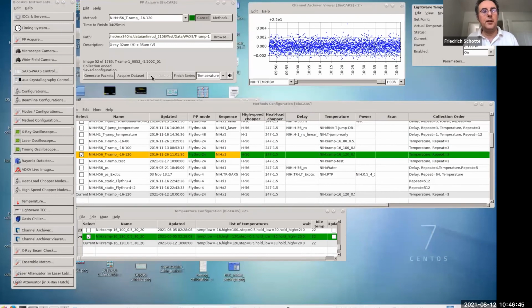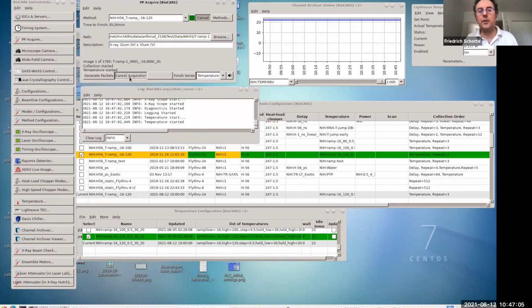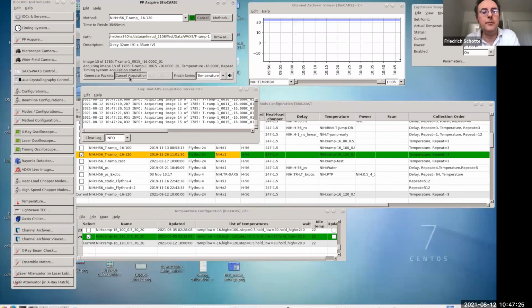So now I've entered a new destination here, so it should be ready to fire. Let me keep an eye on this log file. The first thing it does is ramp down to -16. Normally it takes a bit longer, but this is a simulator, so it's blazing fast, cooling down. And then it's holding the temperature of -16 for 30 images. It's about 1 second per image, maybe 1.1 seconds. And then it will continuously adjust the temperature, ramping up to 120 degrees at a rate of half a degree per image.